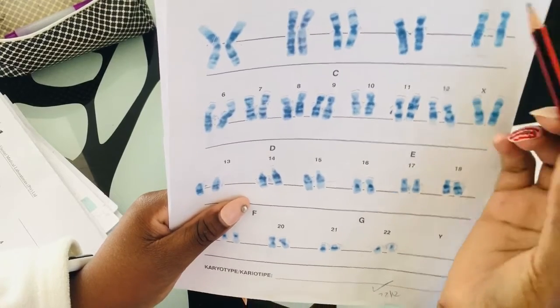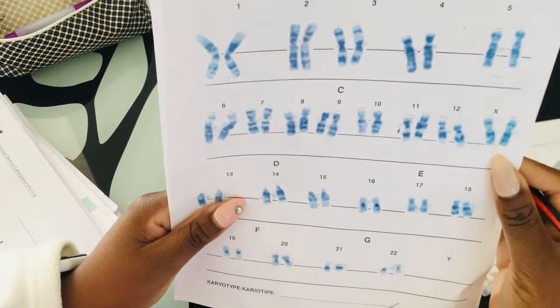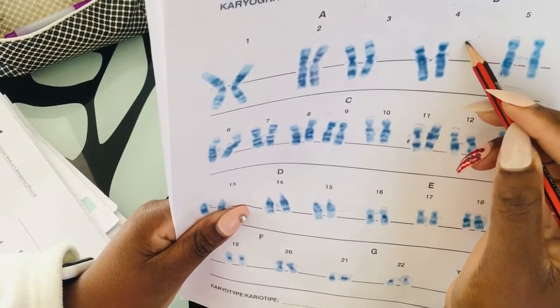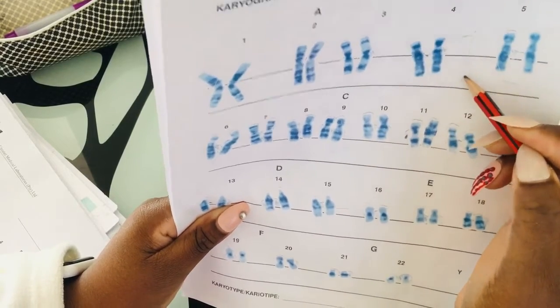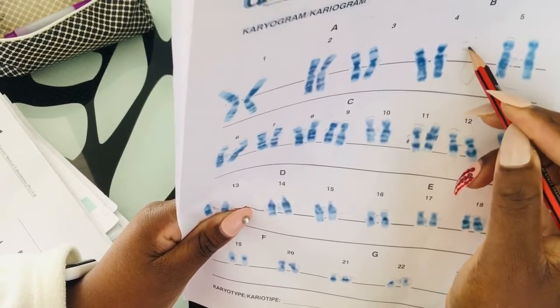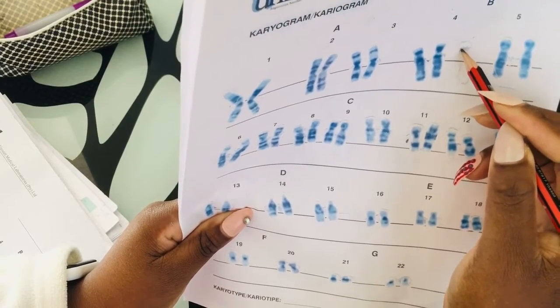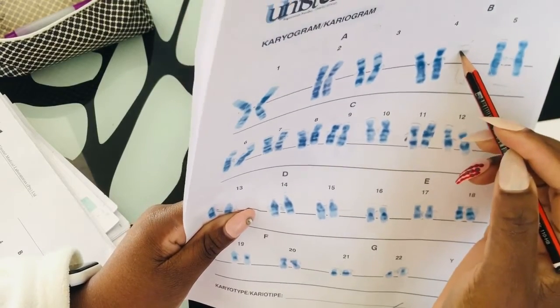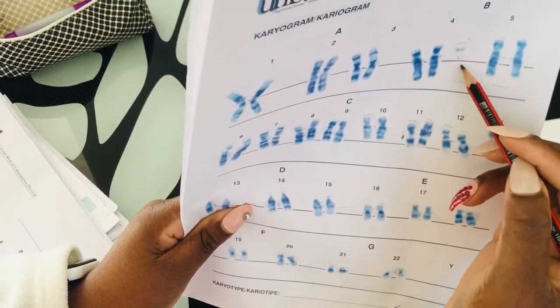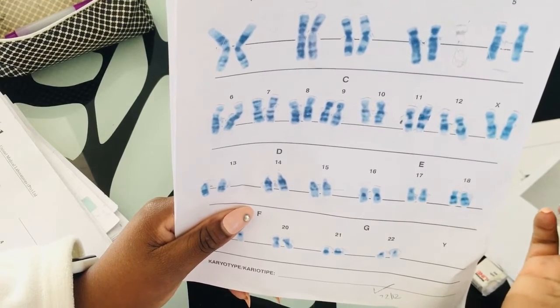Your chromosome 4, as you can see, I wish I could draw, but anyway. So, your chromosome 4, like you can see. Close to the centromere, it is submetacentric as well. Close to the centromere, you're going to notice this very dark band. It's always there, close to your centromere. And then you get other bands here. This is your chromosome 4, your 4th largest chromosome.